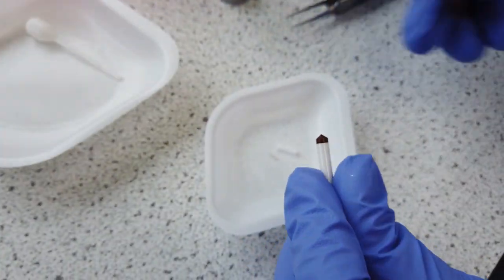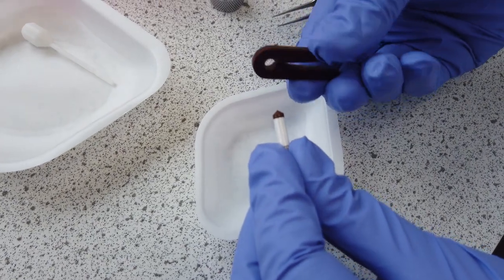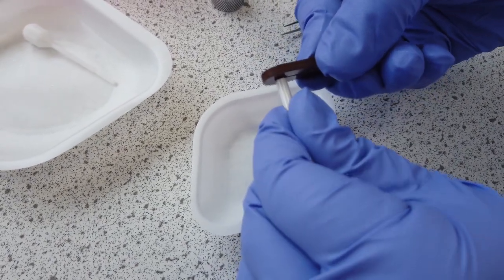Use the opening tool to remove the drive tip by twisting it. Once again, it can help to use liquid nitrogen.